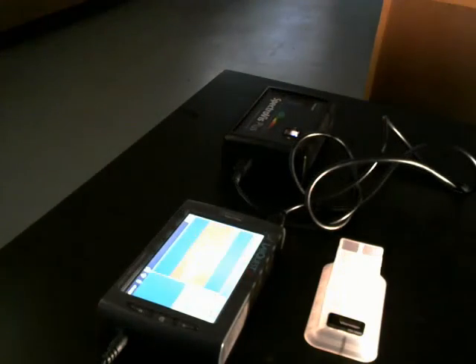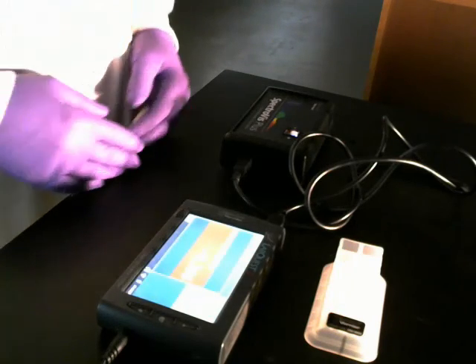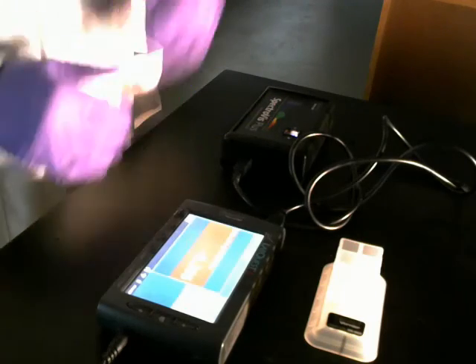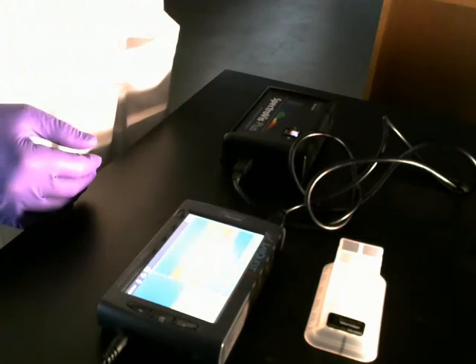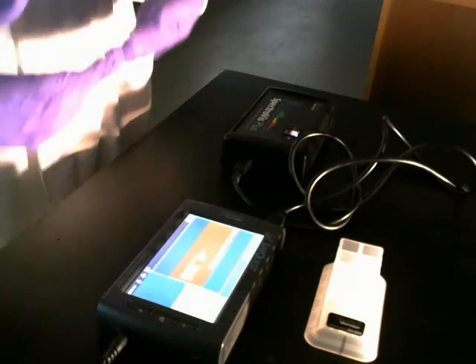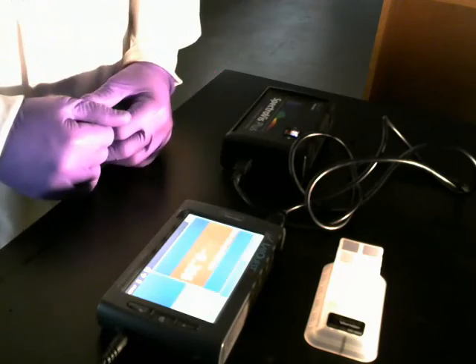So as I was saying, if your hypothesis was about the effect of color on the Hill reaction, then you would have added the same things to all the cuvettes. You would have still had a dark control. You still would have had a no chloroplast control. But instead of setting them at different distances, you'd wrap them in different colored cellophane, say red, green, and blue, for example, and set them all equidistant from your light source.